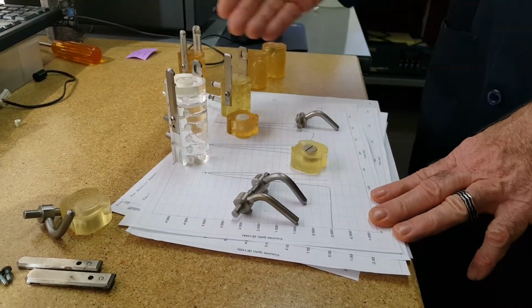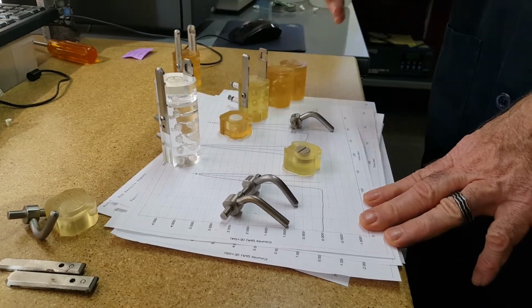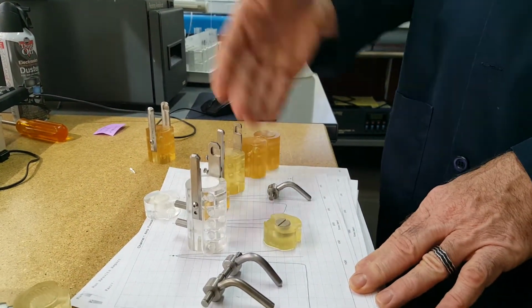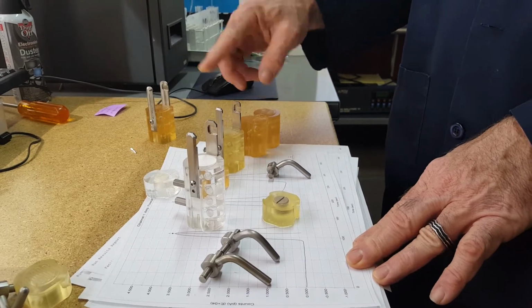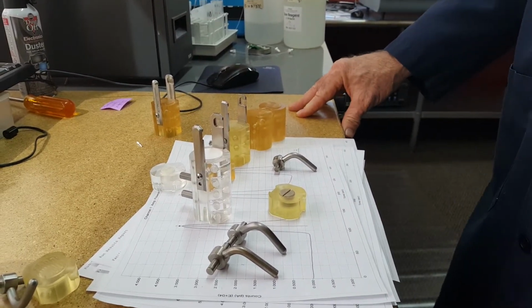The two basic types are acrylic and polysulfone. They really are very much the same. They have the same channels and whatnot, but some people prefer the polysulfone. Some applications may have a better sensitivity to chemicals in acrylic. It's hard to say. I'll let you decide on that.